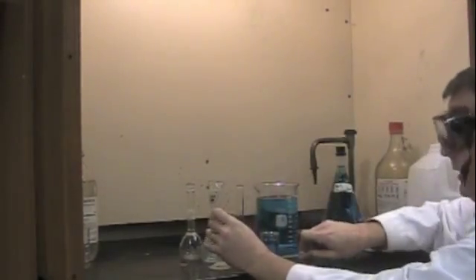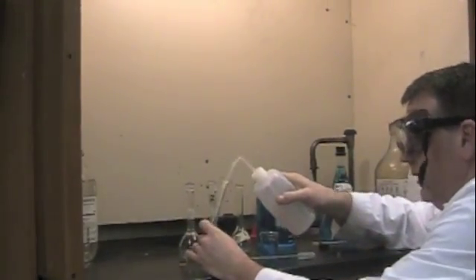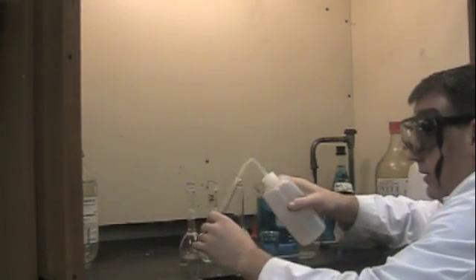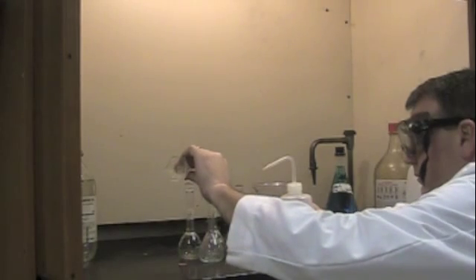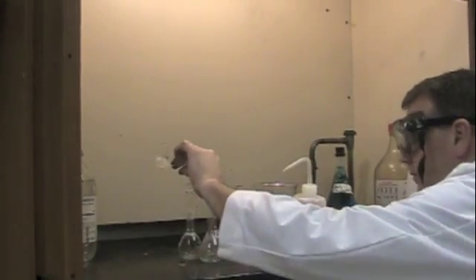It would probably be best at this time to rinse with distilled water because you're going to have to dilute the flask anyway. So you might want to rinse out the graduated cylinder to get out any excess solution and rinse that into the flask.